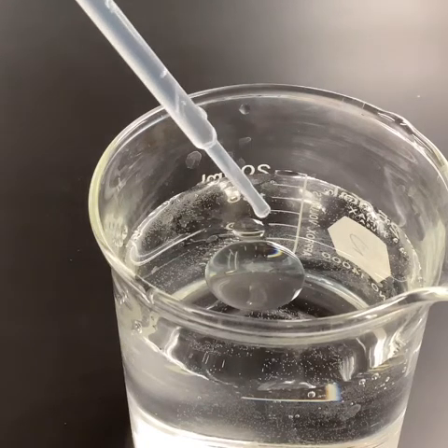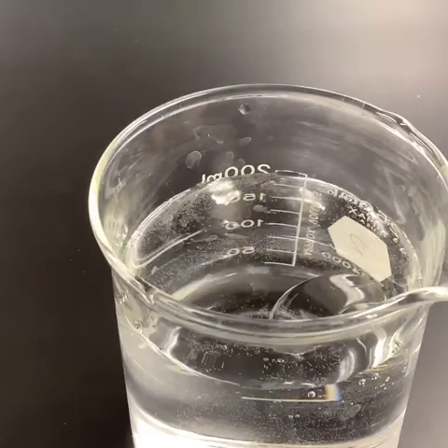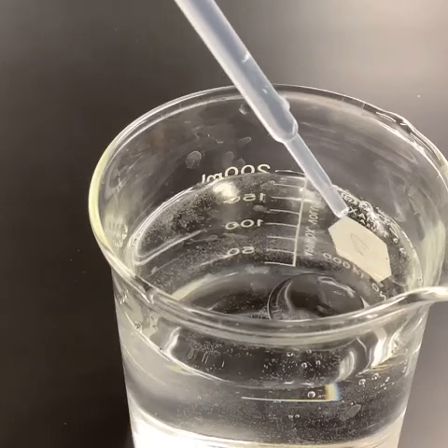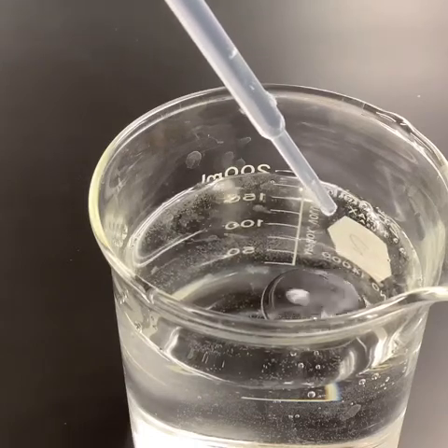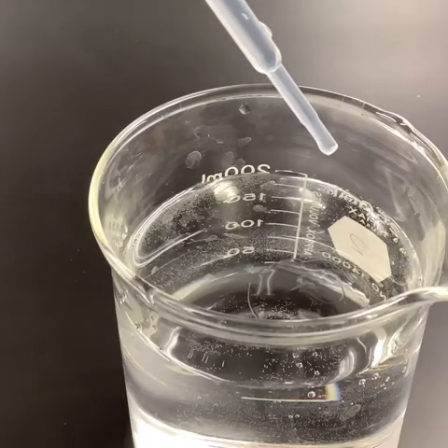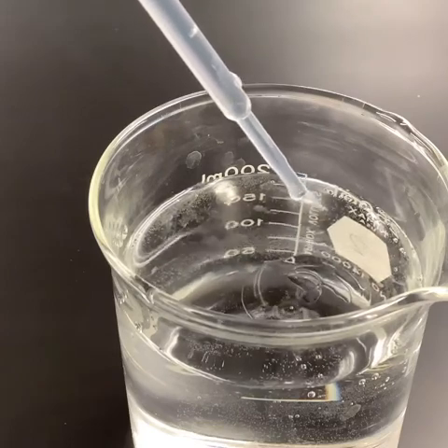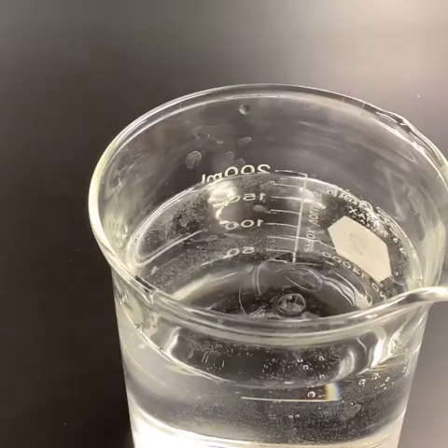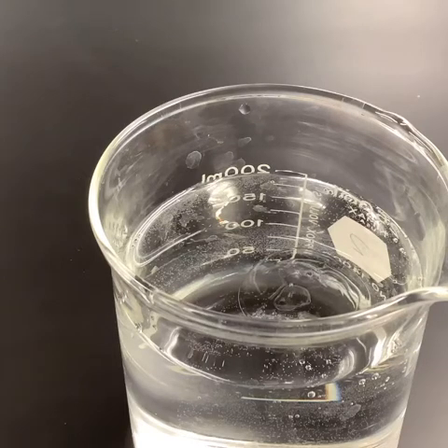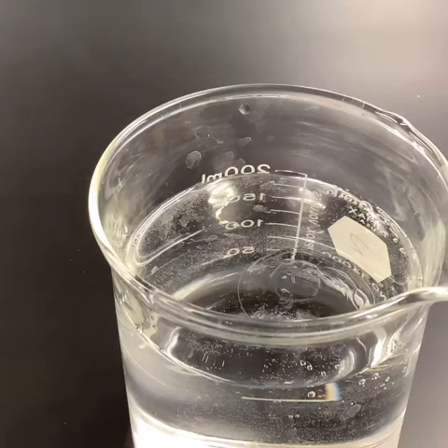Now watch closely on the oil here. One drop, and then boom. Right? We see what's happening here. Okay, so what's starting to happen to the oil in the water once the soap has been added?